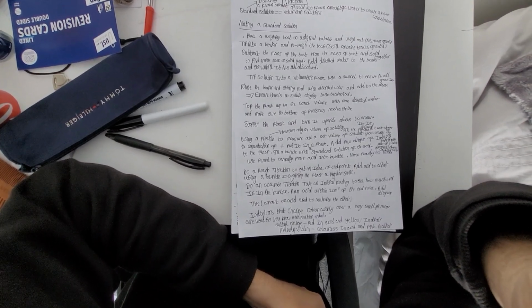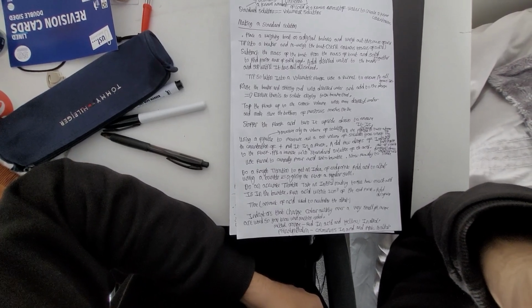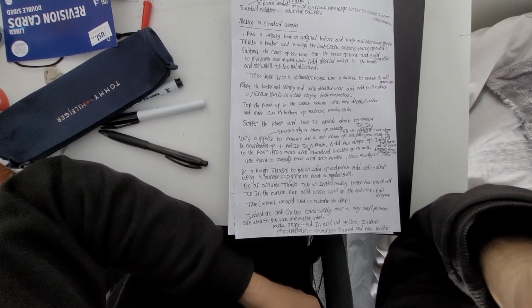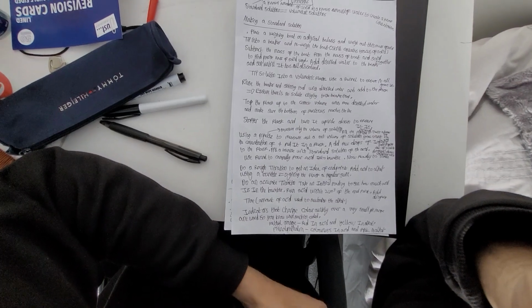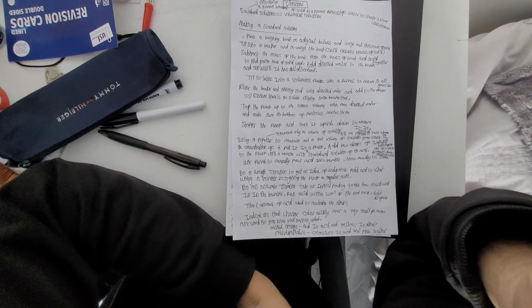Use a pipette to measure out a set volume of the solution you want to know the concentration of. The thing about a pipette is that it only measures one volume of solution. Therefore, fill the pipette to just above the line, then take the pipette out of the solution and carefully drop the level down to the line. Add it to the flask. Fill a burette with the standard solution of the acid, using a funnel to carefully pour the acid in the burette. Now it is ready to titrate.